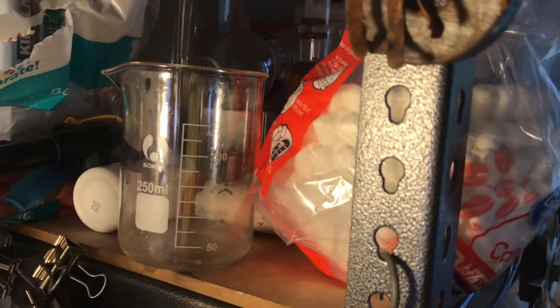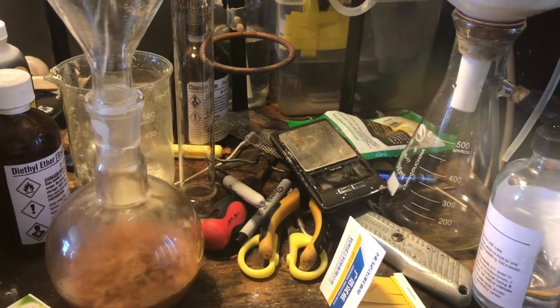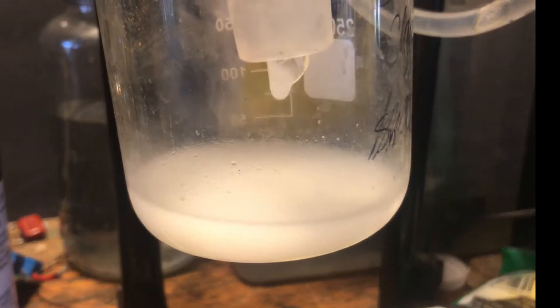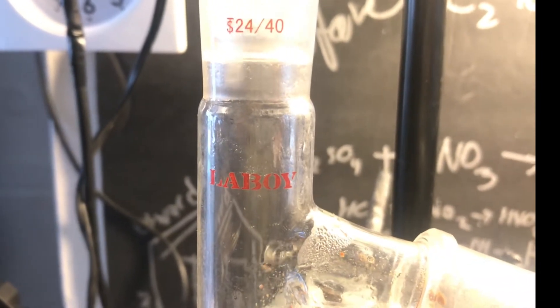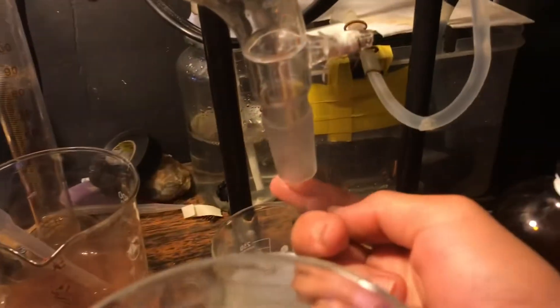In your flask, add about the same or slightly more amount of water — ideally not a sludge but more of a slurry. Then set up for normal distillation. This is a crude form of steam distillation, but it works fairly well. There was a foam-over at the beginning, but that's fine. You can see the distillate is cloudy because of the cinnamaldehyde in the water. On top I have a dropping funnel with more water, because it's the steam doing the work. Just match the dripping speed.